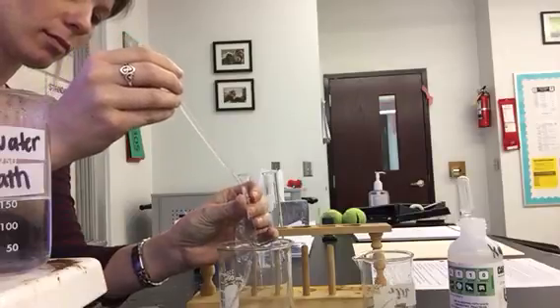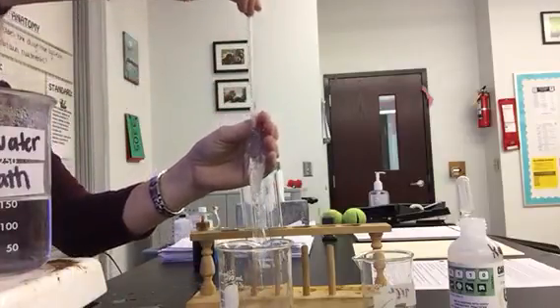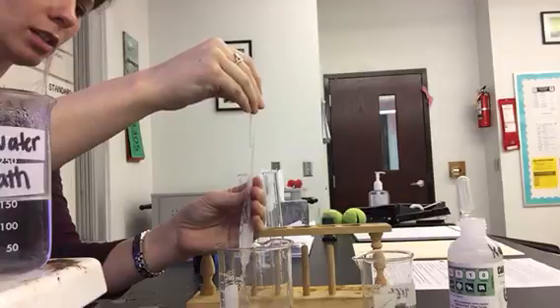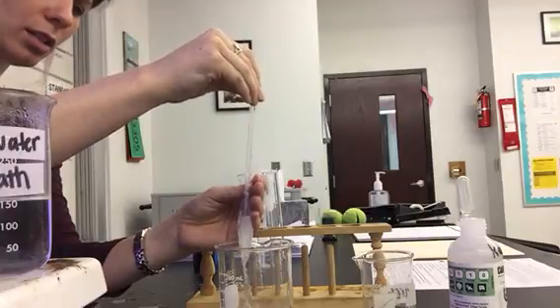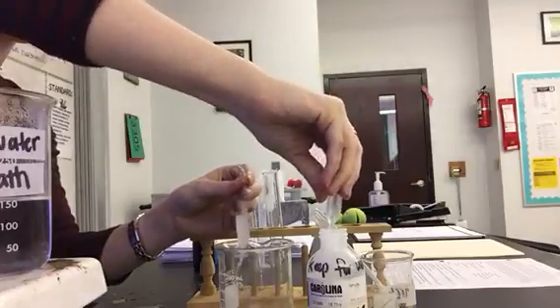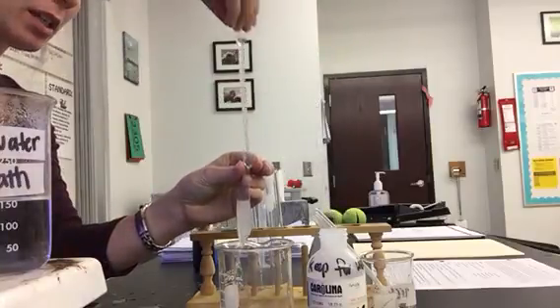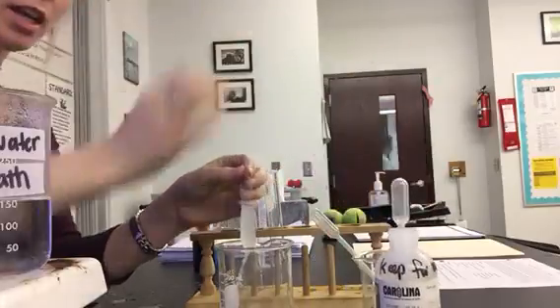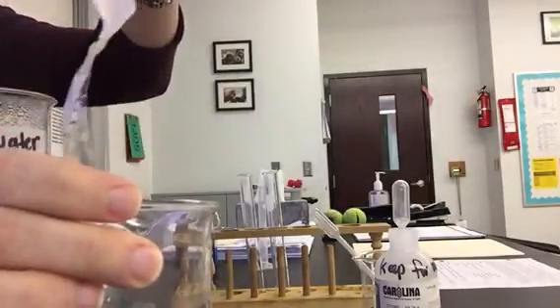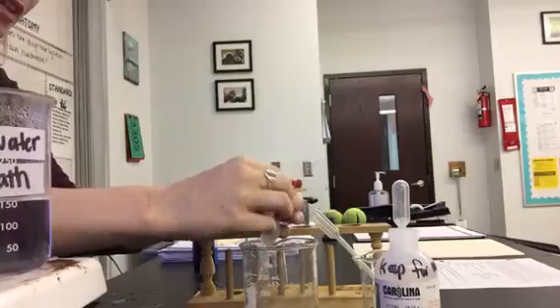I'm also going to put glucose in — that's this container. We're going to see which one crosses through the bag. I've got this container filled with water, and we're going to see which one of the molecules actually leaves the bag and enters into the water, where it's a lower concentration. You know that molecules move from high to low concentration.